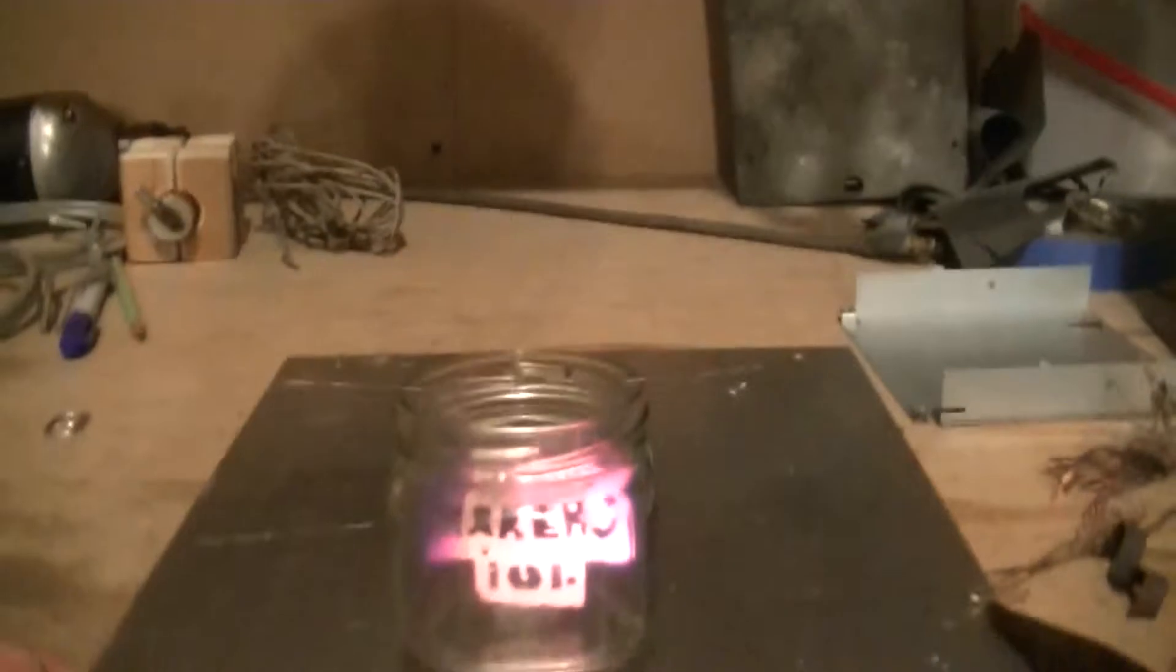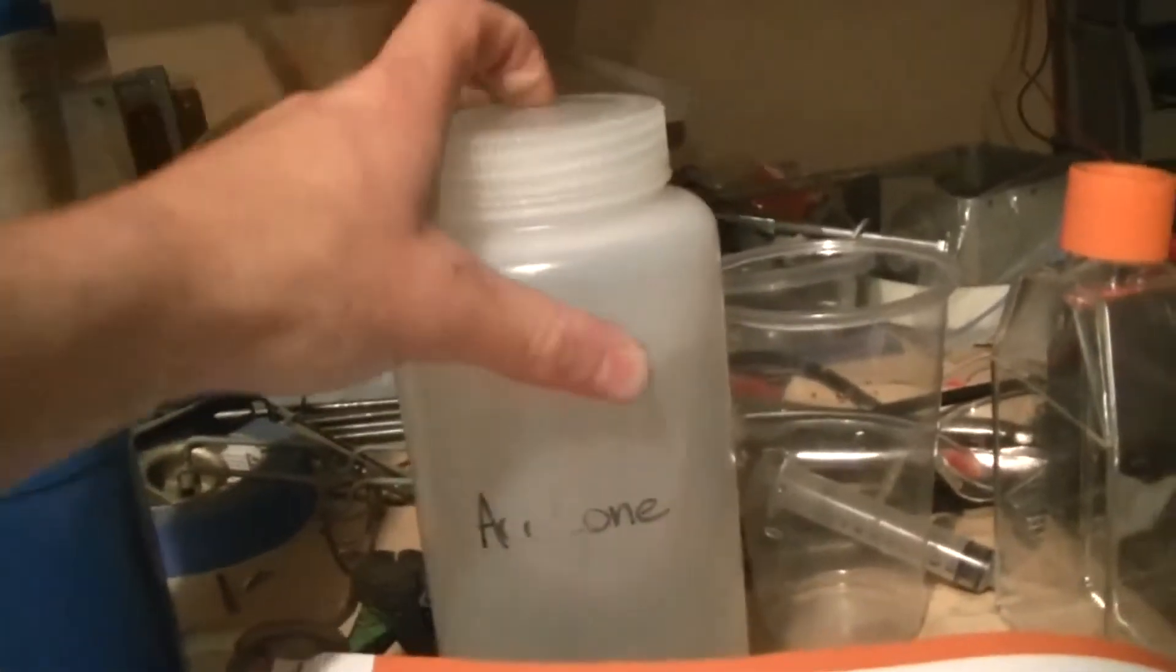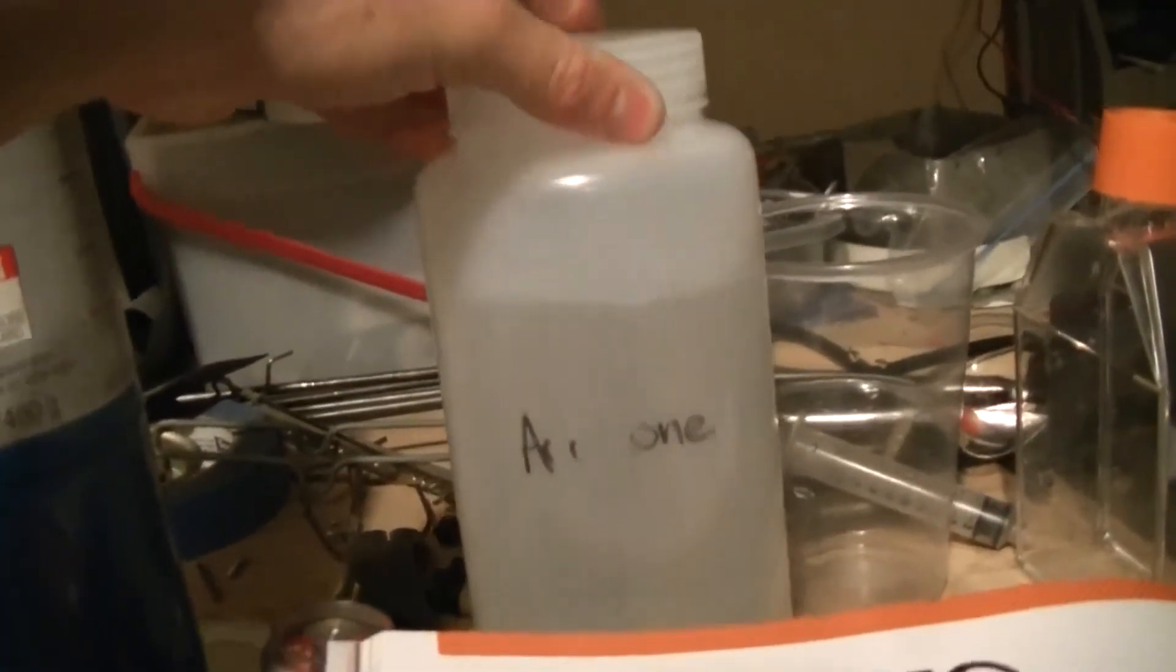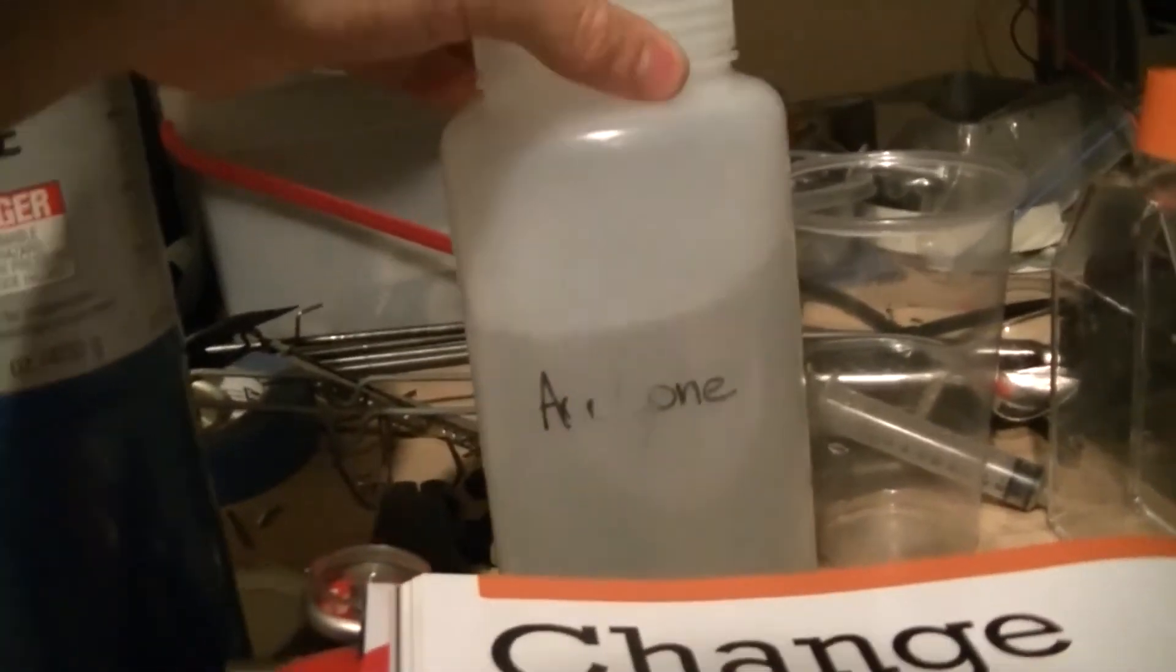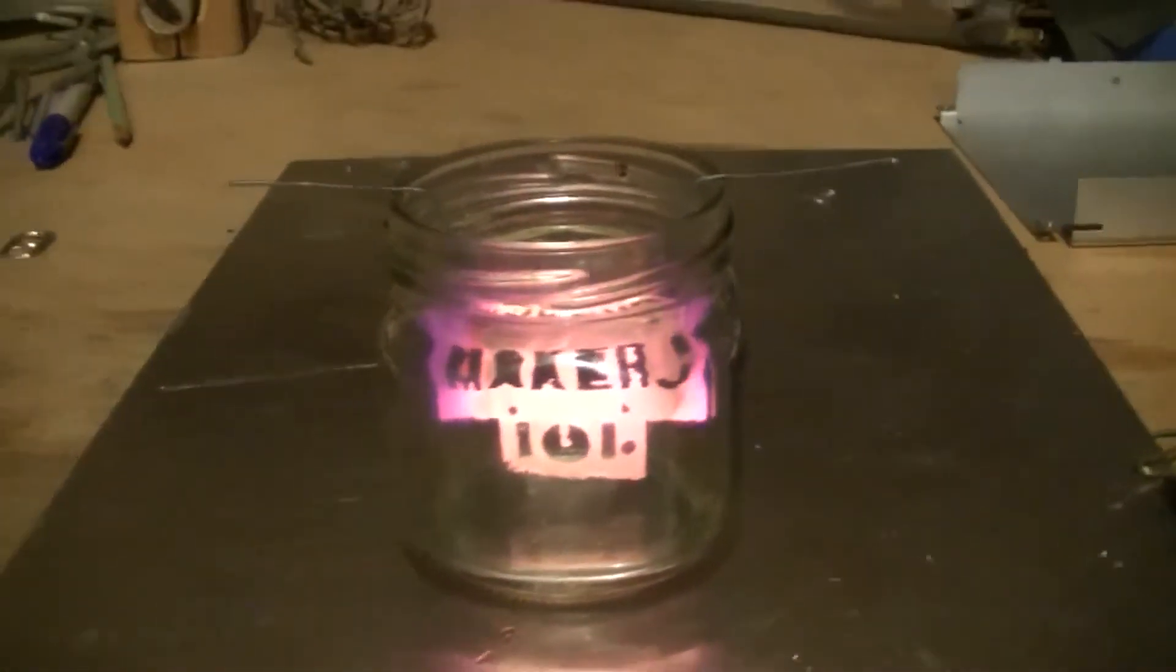Just because it's a catalyst, it doesn't actually get used up in the reaction. But I did try nail polish and it actually didn't work. I don't think the nail polish was high enough concentration. This is I think 99% pure acetone. I'm not really sure, but it's pretty pure stuff.